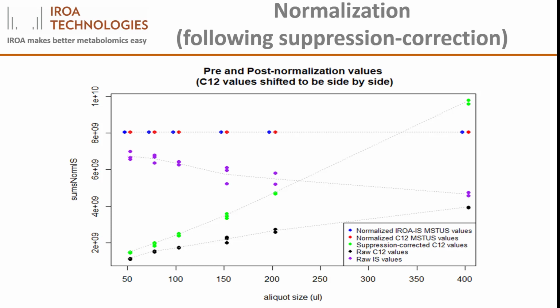Using suppression-corrected data, it was possible to use a dual MSTUS normalization to normalize all of the samples, even though they were extremely different in their original aliquot sizes. This summary slide shows the raw C12 data in black exhibiting severe ion suppression. The suppression-corrected data is shown in green, and the C12 normalized and suppression-corrected data is shown in red. While these samples were very different sizes, they were perfectly normalized and mathematically corrected to report signals as if all the samples had started at exactly the same size.